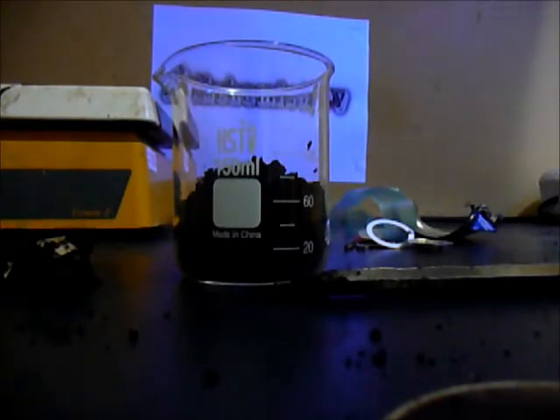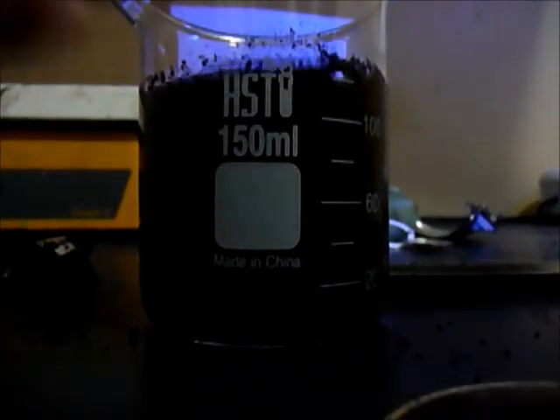Just get DI water which I'm getting right now and a stir rod which I have right here. So this is about 60 grams per 100 milliliters of DI water. Okay, that's about it and the next step, stir it, stir for a very long time. I'm not gonna filter it because I'm gonna leave it right here for probably a day where everything could be dissolved.